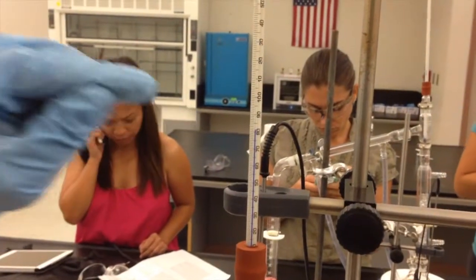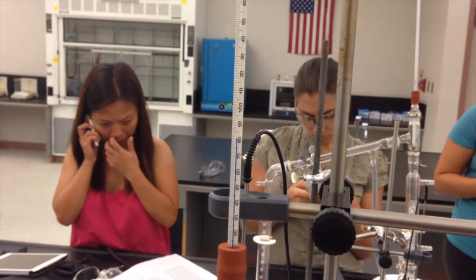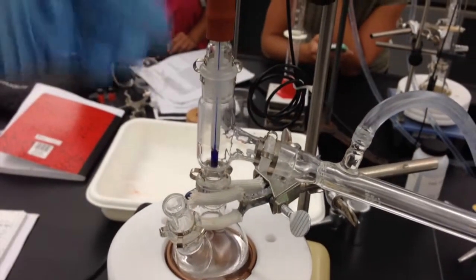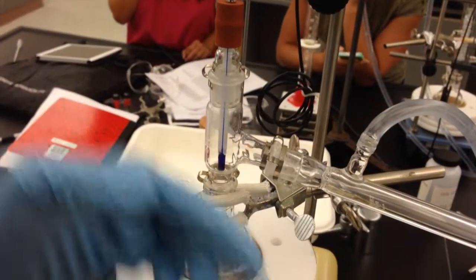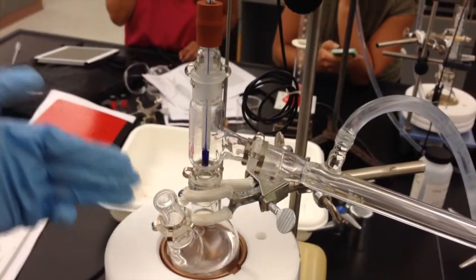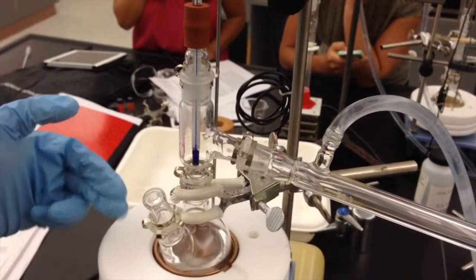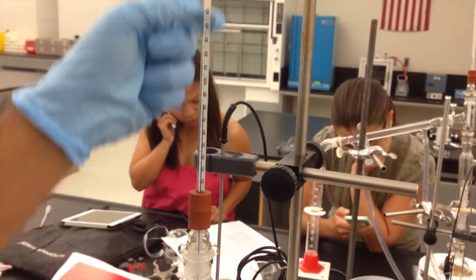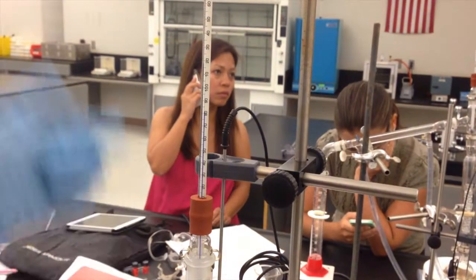Now it's going to stay at this point until technically all the cyclohexane has been boiled out of this compound. Once all the cyclohexane has evaporated out, what's left is toluene. Since toluene has a much higher boiling point than cyclohexane, the temperature, after it plateaus, will skyrocket a little bit further up the chain. Once we know that things started skyrocketing up, it's basically evaporating only toluene.